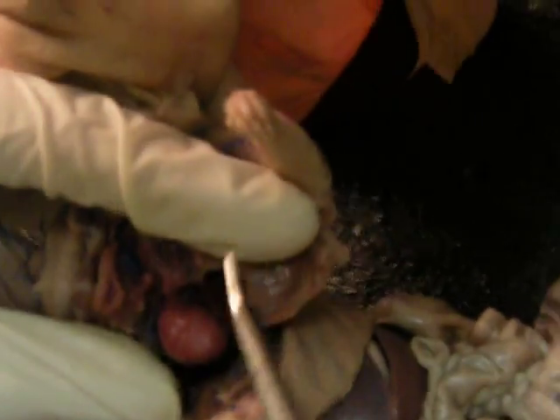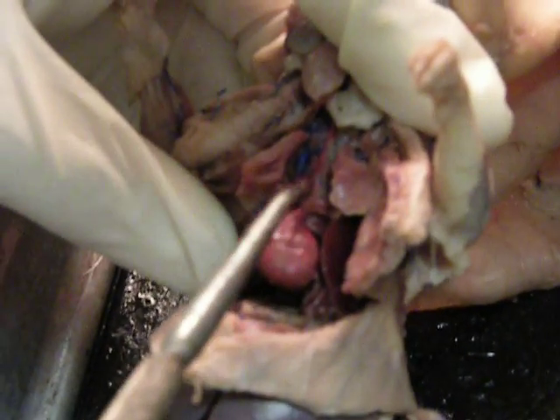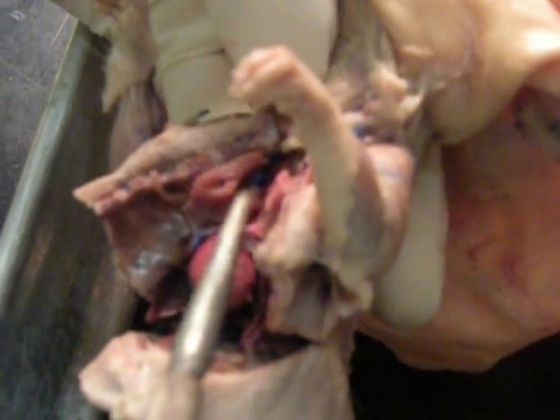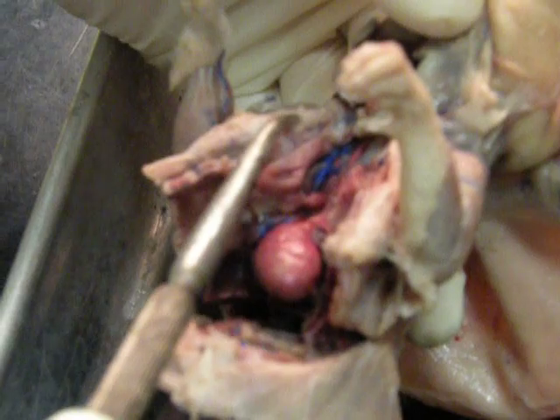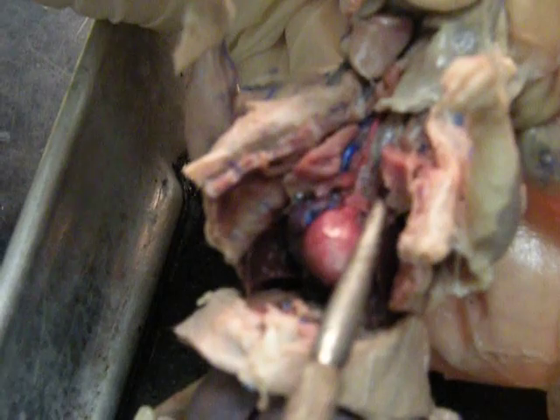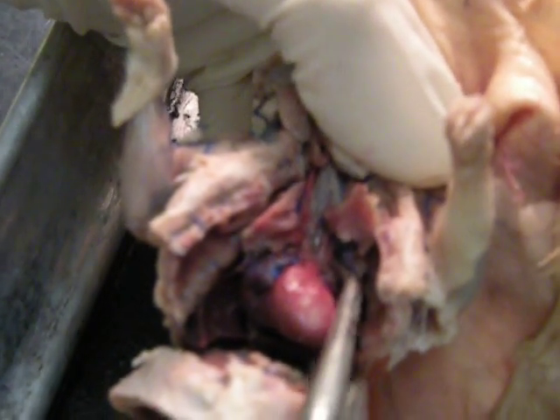Let's go over some of the veins and arteries here. From your heart, you have your aortic arch right here, and there are three branches coming from your aortic arch. The first one is your brachiocephalic trunk, and if you follow it a little bit, you'll see that it shortly branches into your right common carotid, and then there's another one that goes to your right subclavian. The next branch off the aortic arch is your left common carotid, and the last one is your left subclavian.